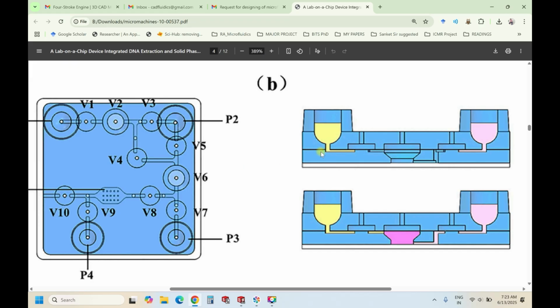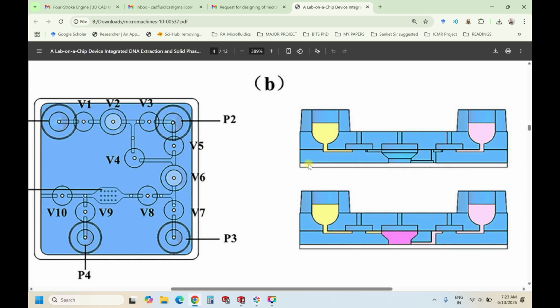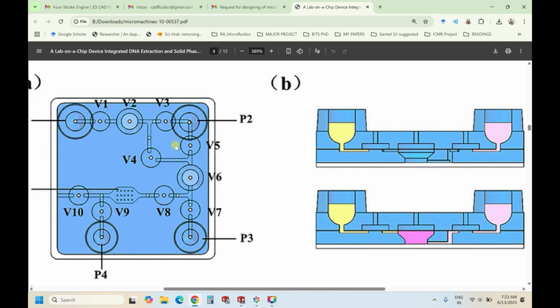And they have used a 3-layered PDMS channel. Instead of this, we can do a simple 3D printed one, which I'll show you. Considering this line, this line is the glass, and this is the first layer, second layer, third layer. Just by seeing this, it makes it a little difficult for the normal reader to understand in one go. So if you see here, V2 is this channel. V2 has a third layer breakout here, then moves to the second layer, and then comes to the top. That is represented with this gray shaded region, V2.